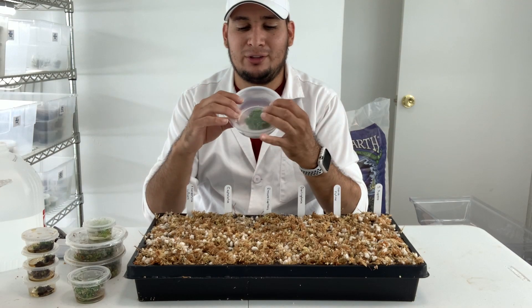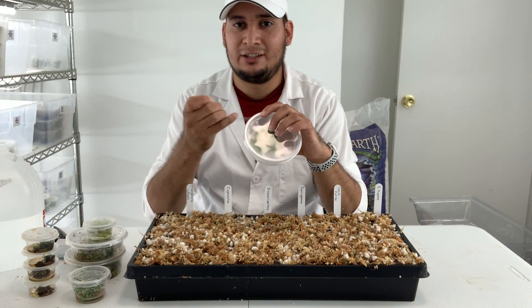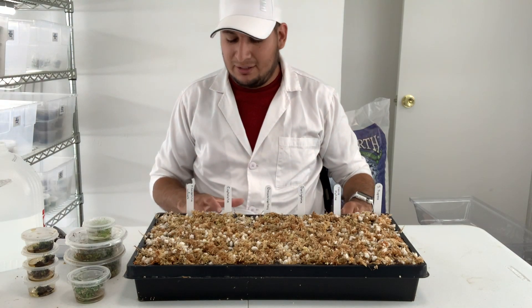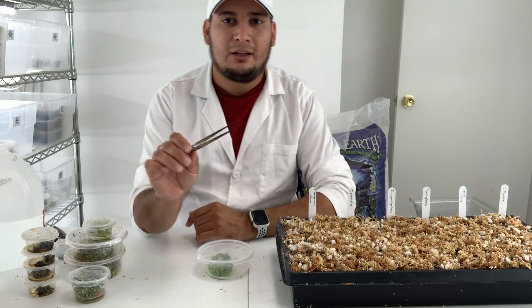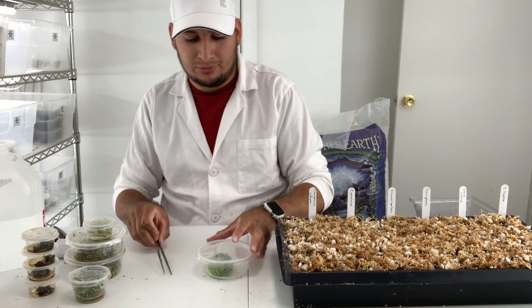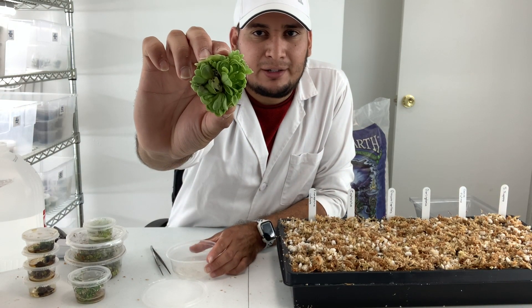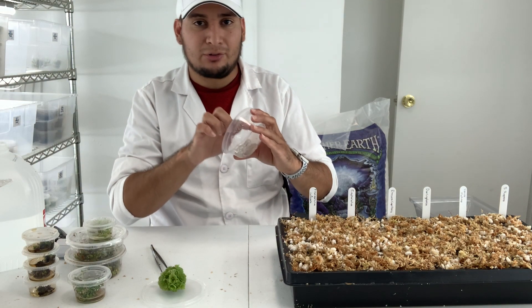Let's get started with the Pinguicula. The date on this is from October 2020, so it's been here for a while. A lot of these plants need new media badly, and unfortunately many of them are very small — not really to the point where I want to deflask them — but I just want to show you the concept. I'll use my tissue culture forceps, which are very useful for this work.